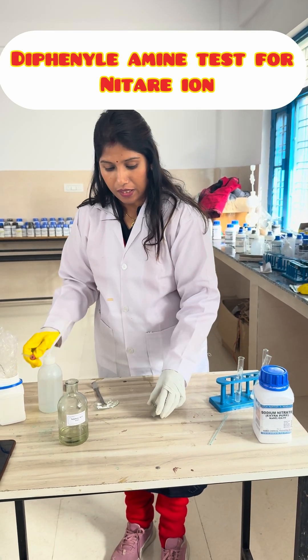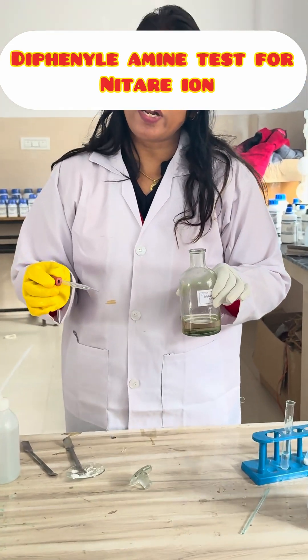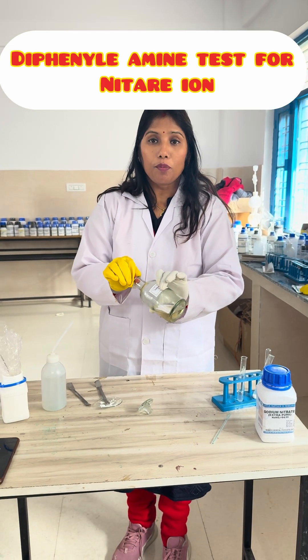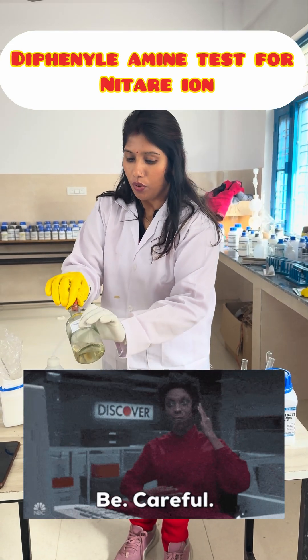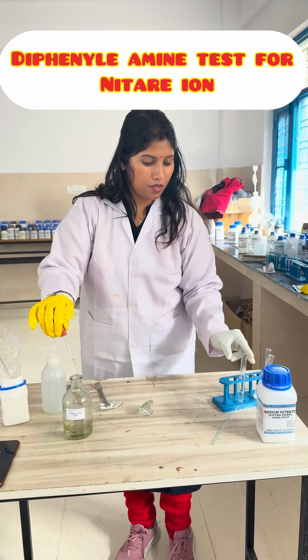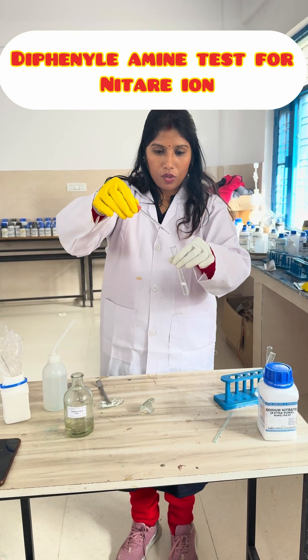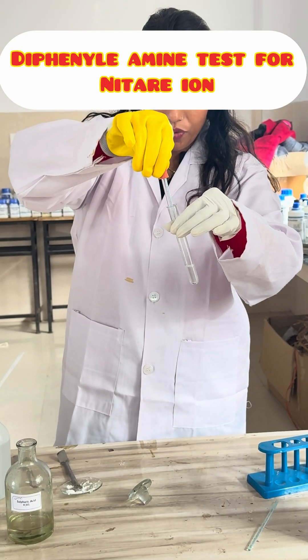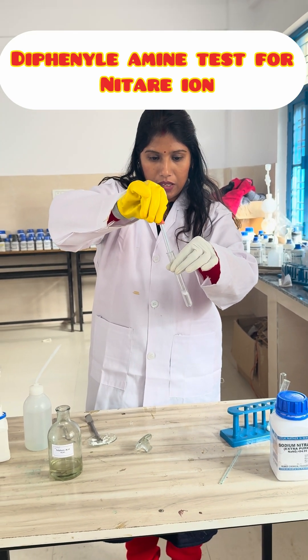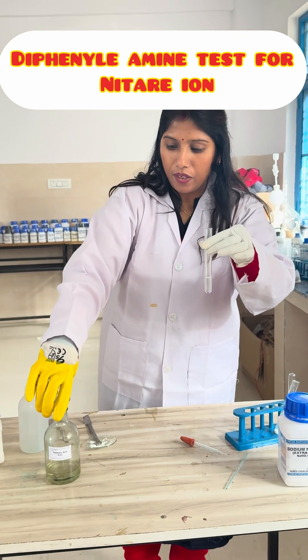Then we will add few drops of concentrated sulphuric acid. Whenever you use concentrated sulphuric acid, be careful because it is very corrosive. So we will add few drops of concentrated sulphuric acid in this sample.